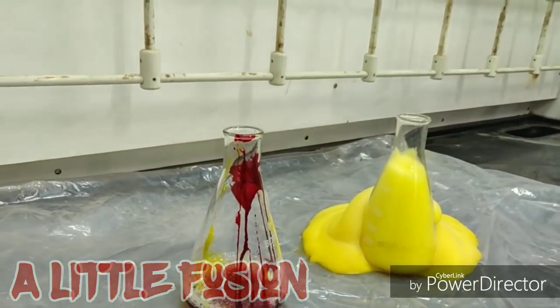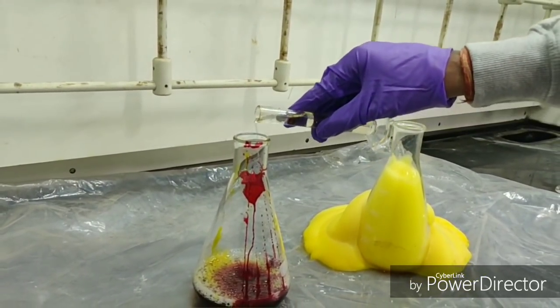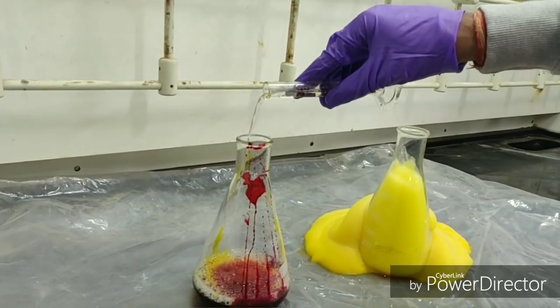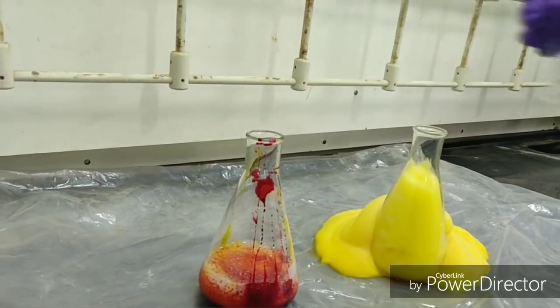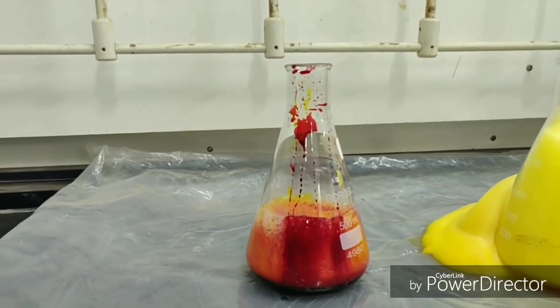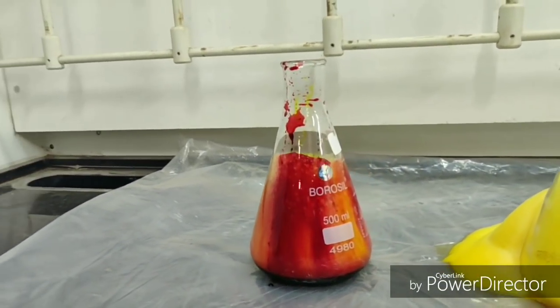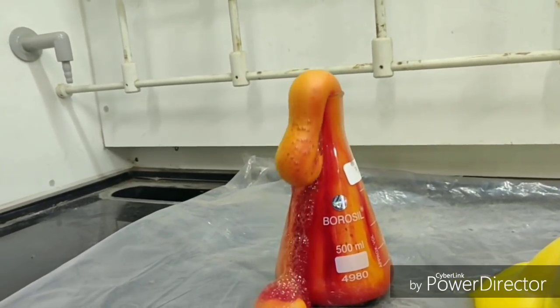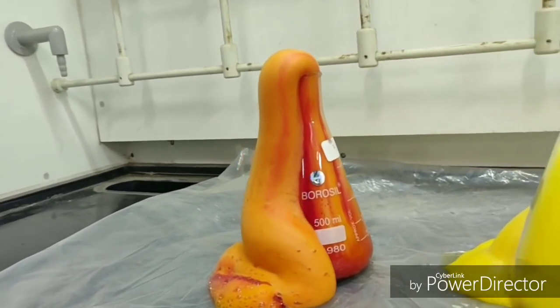Followed by addition of potassium iodide — let's see what happens next. As potassium iodide is being added slowly, we can see the reaction starts by observing the formation of bubbles at the bottom of the flask. As the reaction proceeds further, we see a large amount of foam being formed.